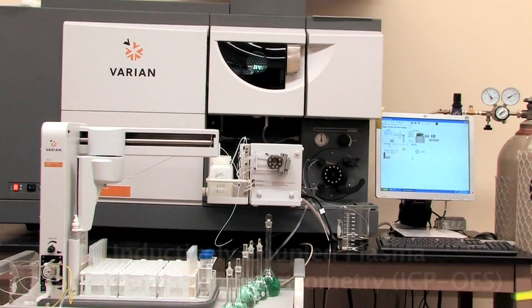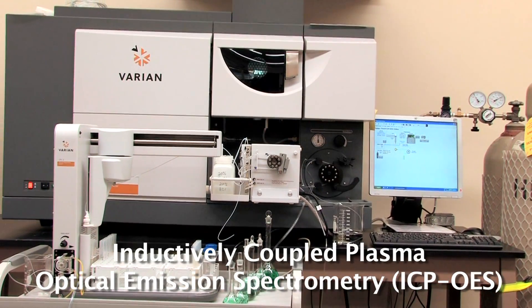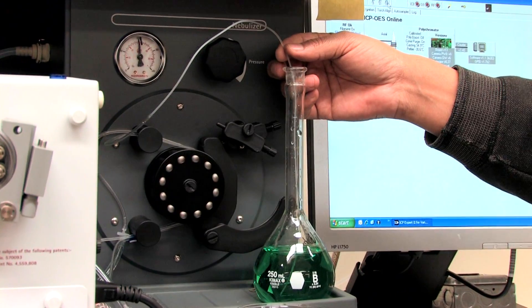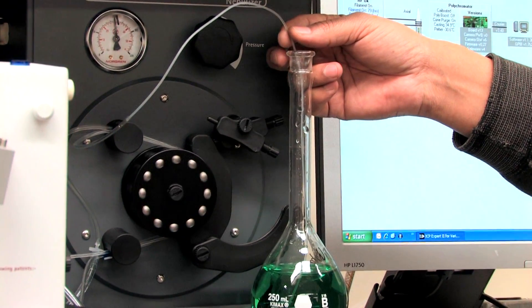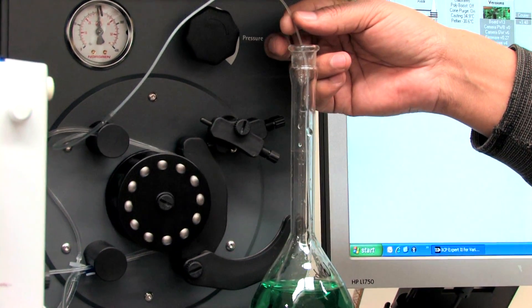We've also got a big workhorse called the inductively coupled plasma optical emission spectrometer. This instrument is pretty neat because you can analyze up to 70 elements at the same time in a given sample, so you can get a lot of information from just one sample.